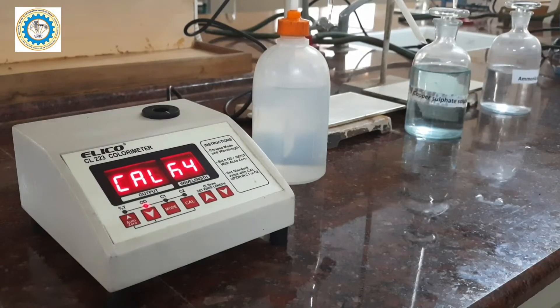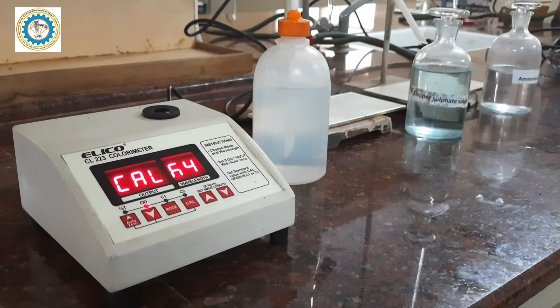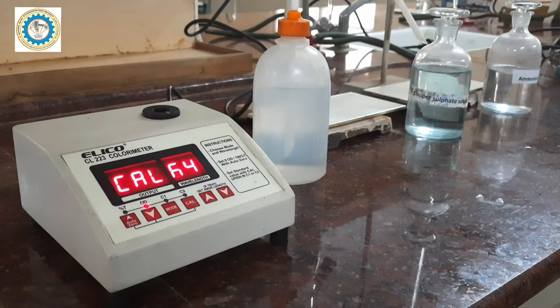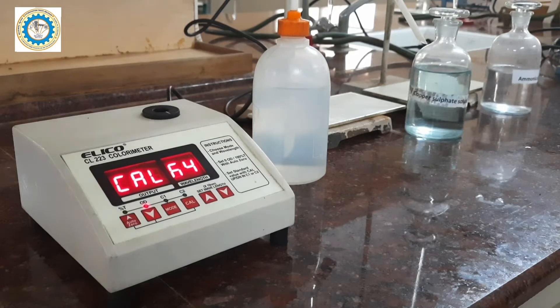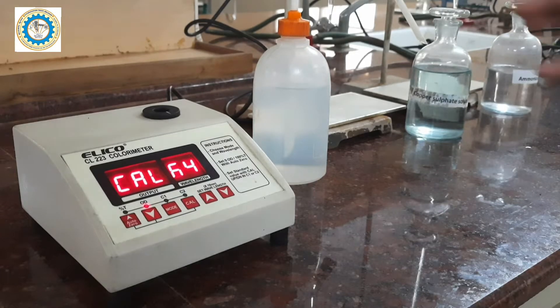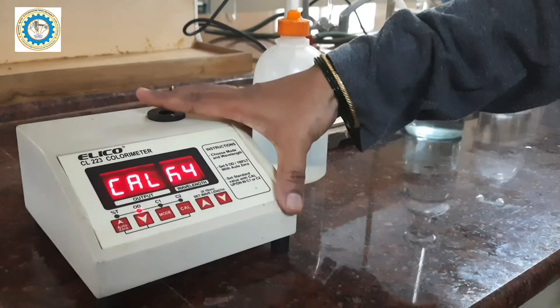Students, today we are going to perform the experiment of colorimetric estimation of copper. To do that, we are going to use the colorimeter. This is the instrument we are using for the colorimeter.